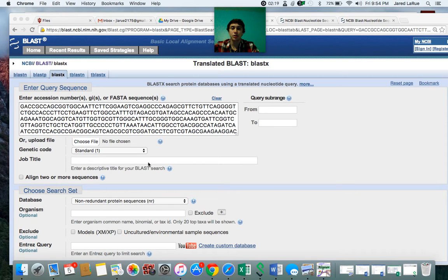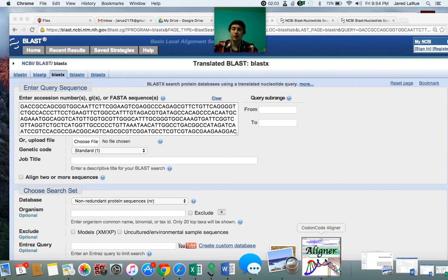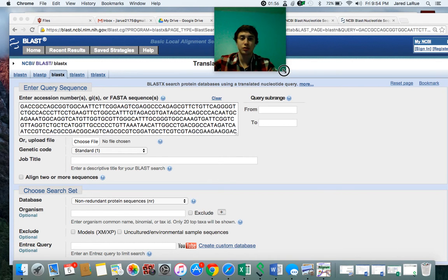So, yep, that's how you use all of the programs, and I hope this has been really helpful. I hope this teaches you how to use all the NCBI internet tools that are available to you, as well as how to use the actual CodonCode Aligner. Everything that I explained to you is everything that I've used that has helped teach me, or that I've had to teach myself to adjust the sequences.